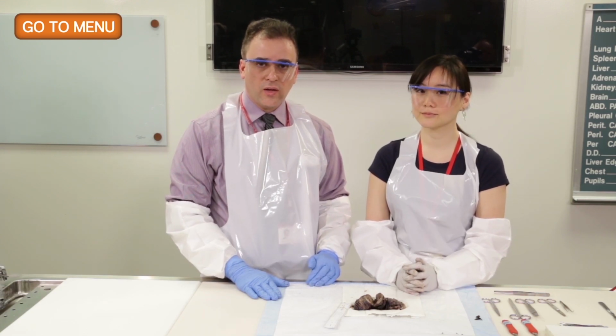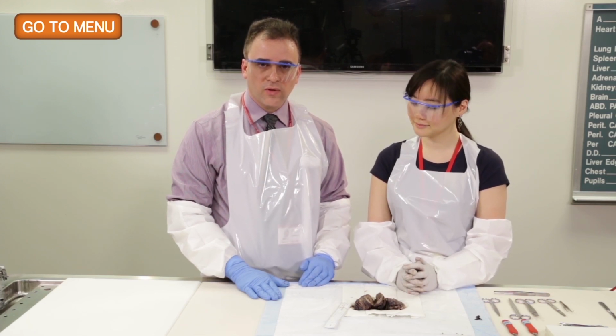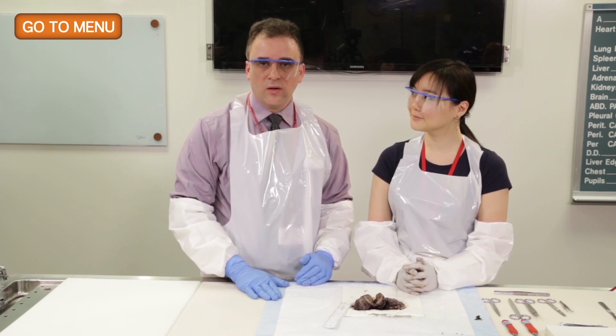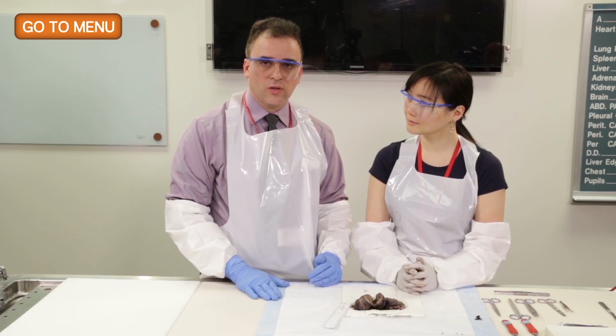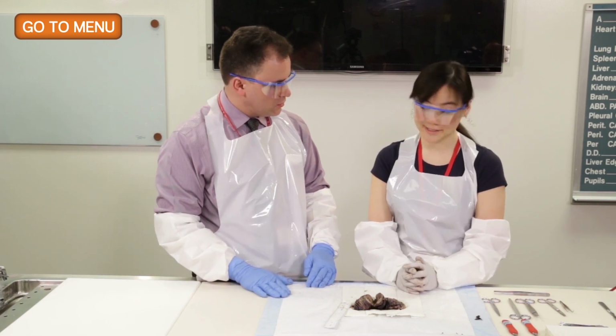In the case of taking tumor to pleura times 2, tumor to margin, and tumor to lung parenchyma times 2, we heard that the tumor was 4 centimeters, and that would exceed a section per centimeter, which was what we talked about. We will also even additionally have a full face section. And so with that, why don't we proceed to take the sections? Sounds good?